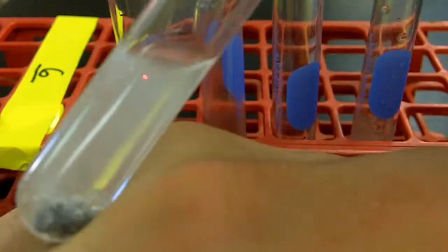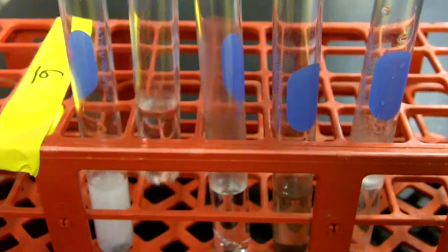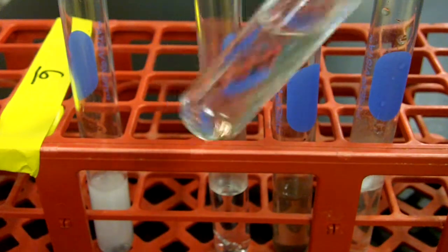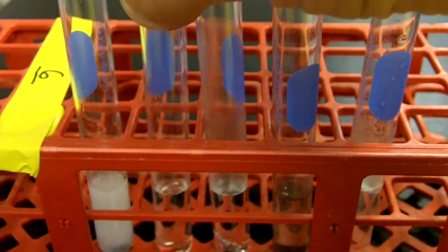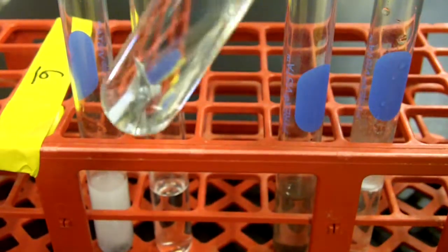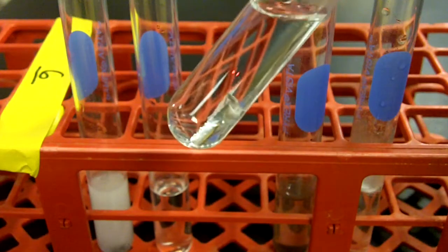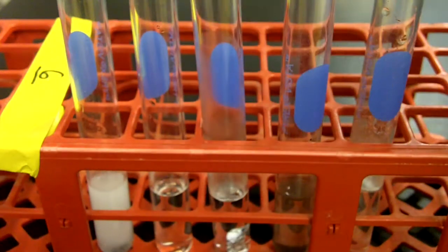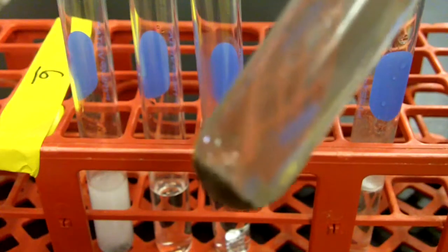I don't feel any heat quite yet, but I will run through a second time. Looking at copper, I don't see the same thing that I saw with the zinc. But the procedure does say wait at least 5 minutes. The aluminum, I don't see anything going on with the aluminum quite yet, really actively, so we'll come back to the aluminum. And then we have iron.